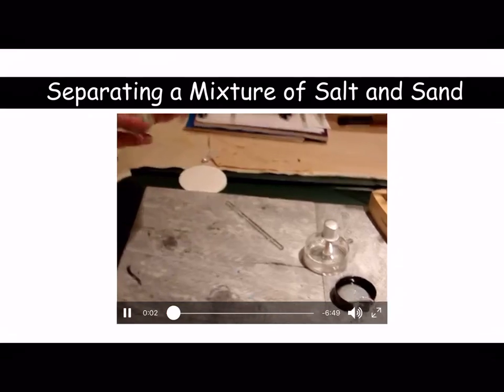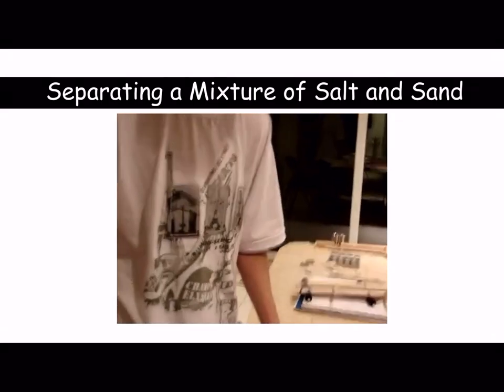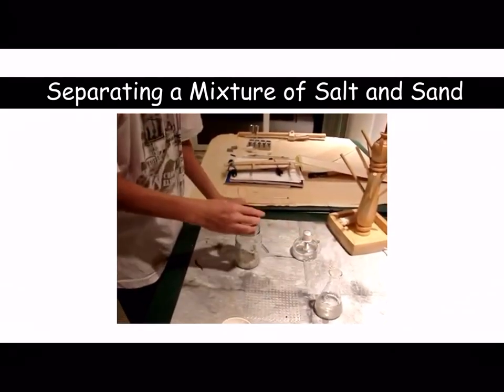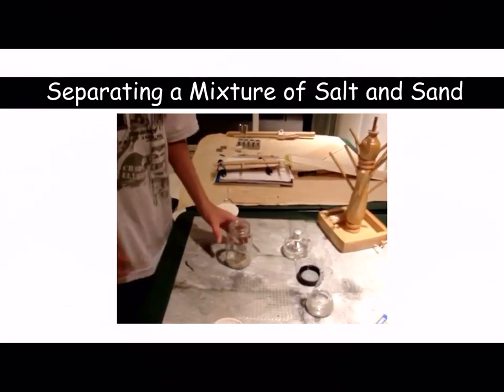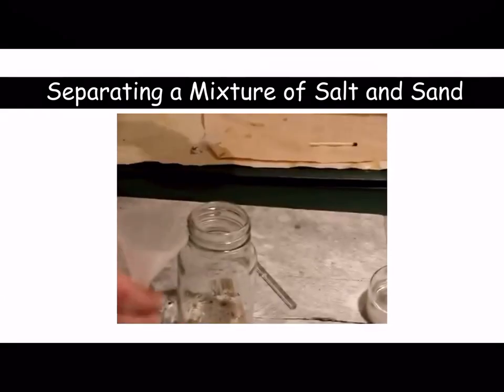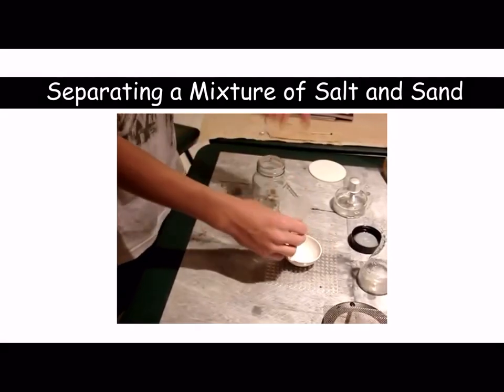So you take your sample of sand and salt, and the first thing I would recommend you do is you'd add some water. What is the benefit of adding the water? Well, the benefit of adding the water is so you can dissolve the salt that is in the sand. So you make a solution of salt and water, but also you have an insoluble solid in the solution, which is the sand.